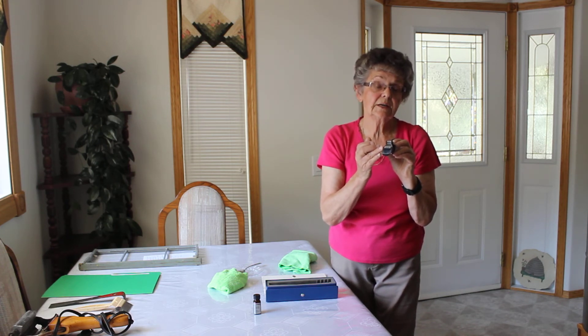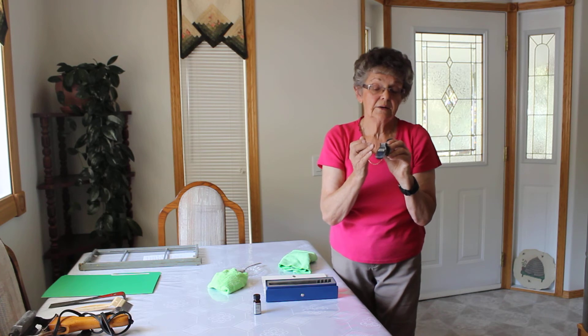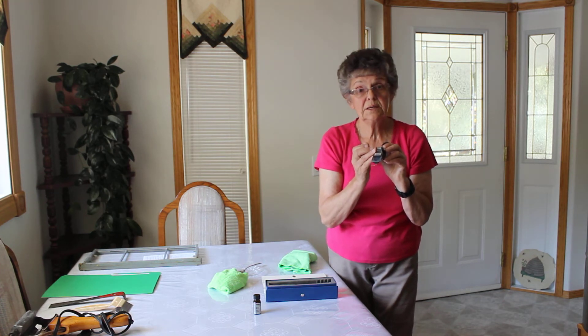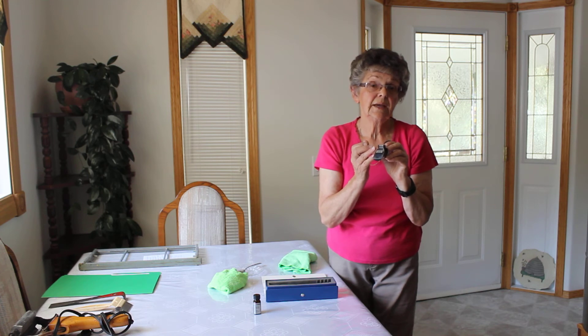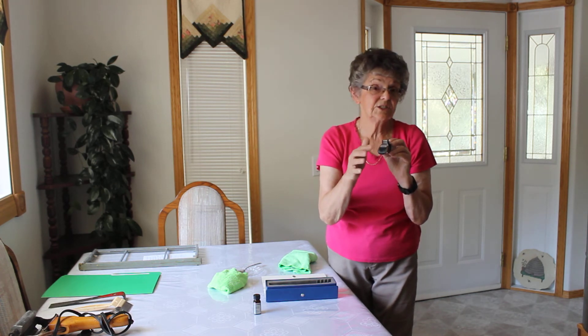This is 17% — it's fairly dry. It can go as dry as 16%, and that is really dry honey. If you want to cream your honey, you want it around 17.5%. That tells you it's going to be a little harder than that creamy like-butter cream honey that you really like. So if it's around 17.5%, that's really good for creaming.